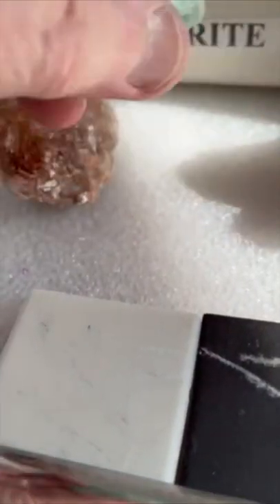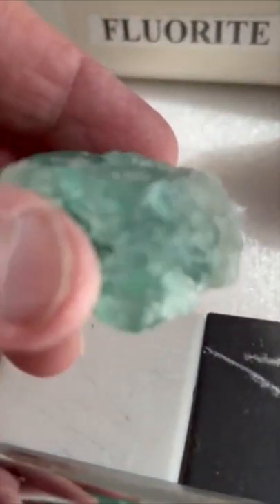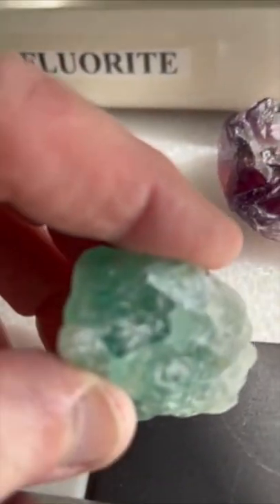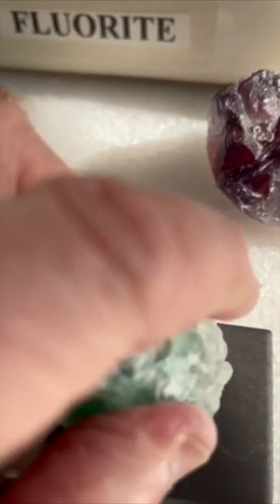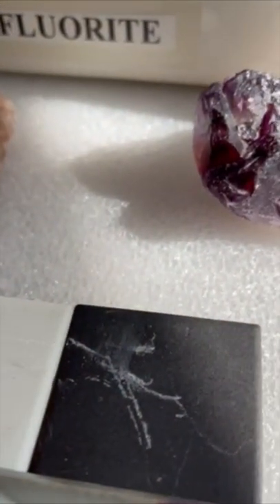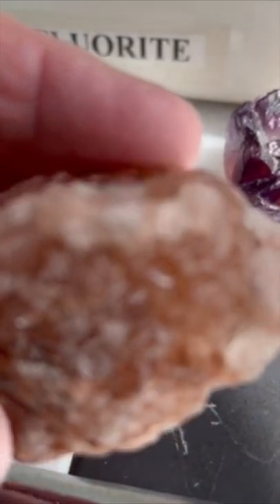Here I'm conducting a simple comparative study called the streak test. Rubbing each specimen across an unglazed square of dark ceramic tile creates a streak of white mineral powder.